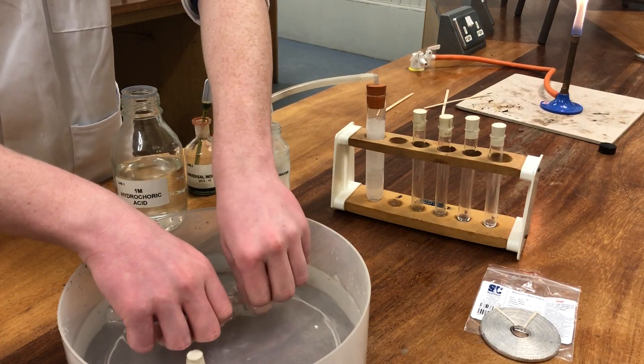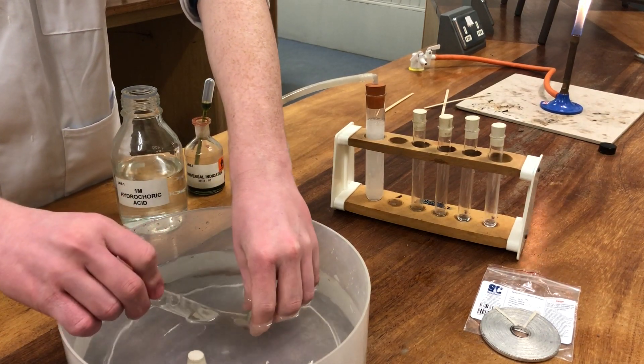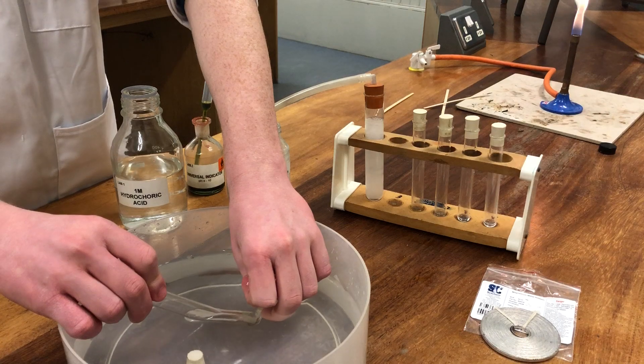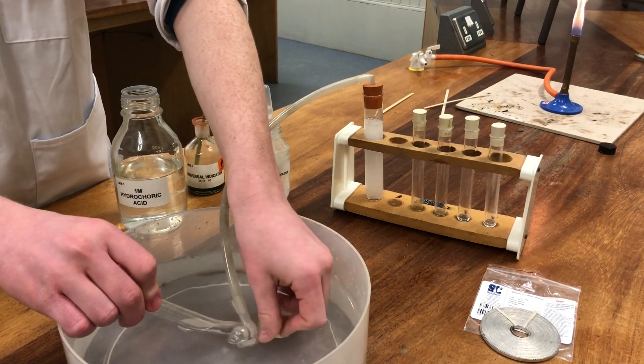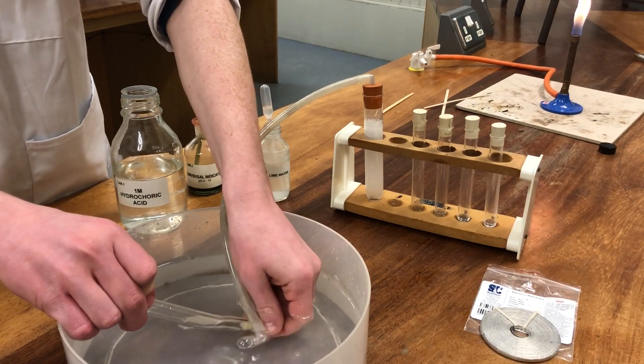We collect the gas over water by the displacement of water in a water-filled test tube. When the bubbles come from the end of the tube, the test tube is full.